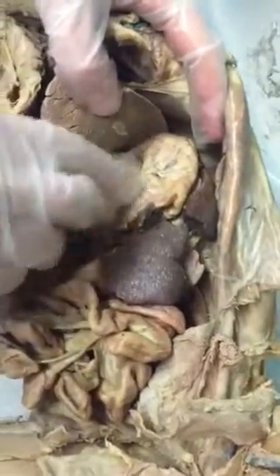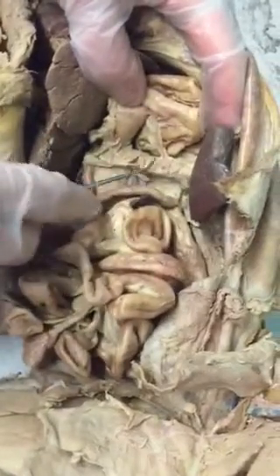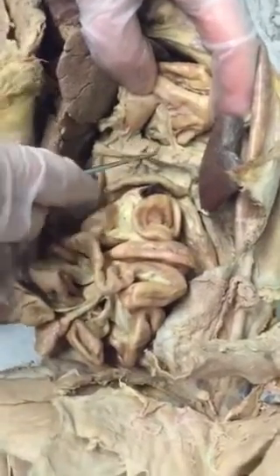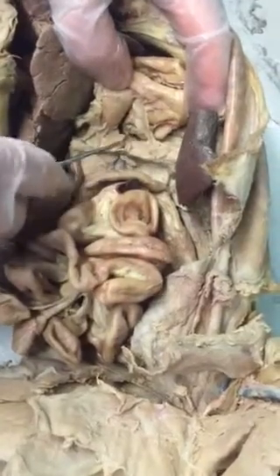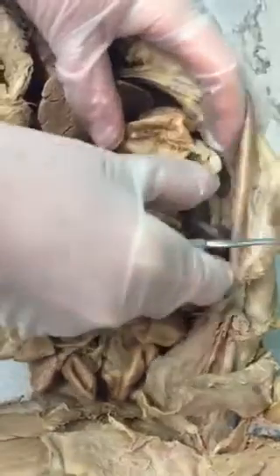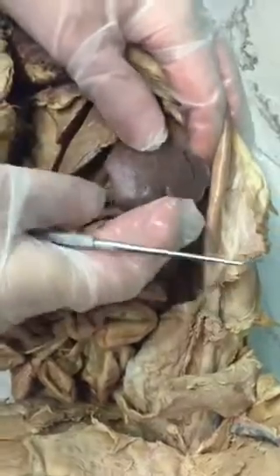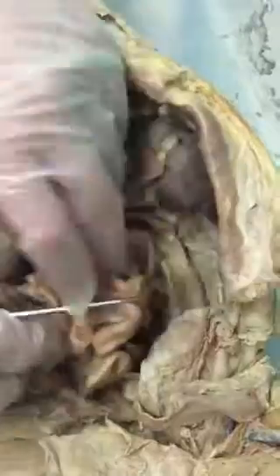This is the stomach, sort of a J shape. And under the stomach, this glandular material here is the pancreas. It's usually a white or beige color, and it's sort of lobular. All right, so this is the pancreas. This got cut a little bit. This is the spleen. The spleen is sort of tongue-shaped, with a reddish-brown color. All right, then we come to the small intestine.